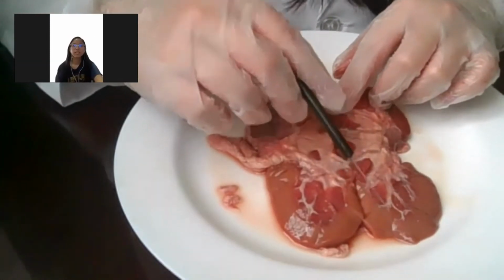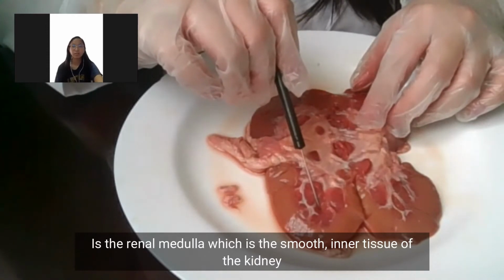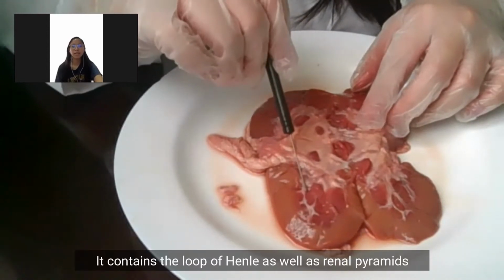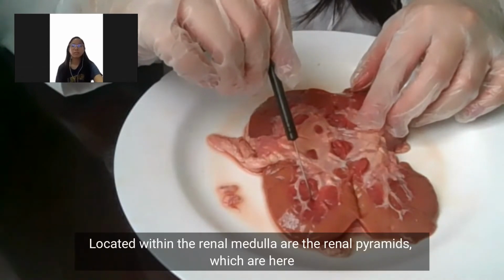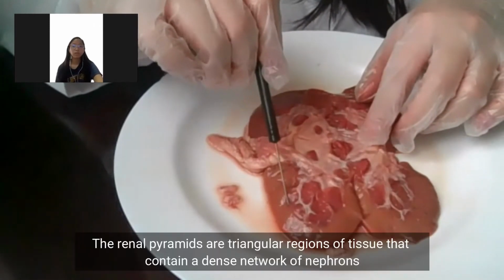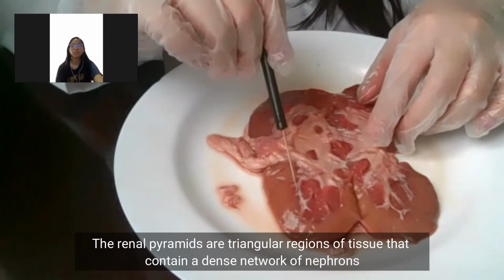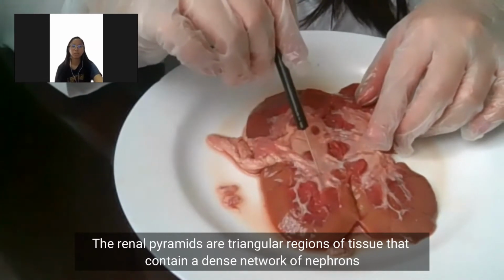So next is the renal medulla, which is the smooth inner tissue of the kidney. It contains the loop of Henle as well as the renal pyramids. Located within the renal medulla are the renal pyramids, which are here. The renal pyramids are triangular regions of tissue that contain a dense network of nephrons.